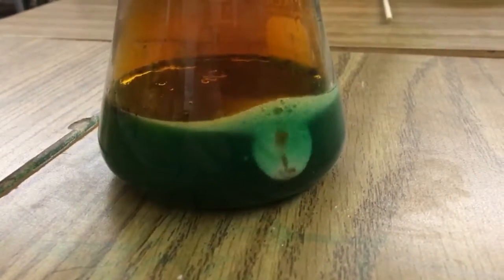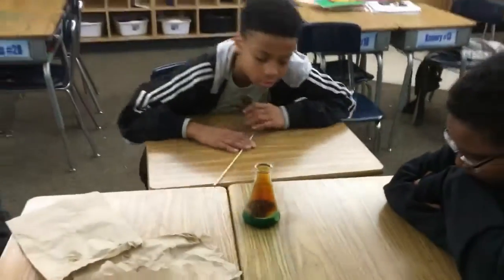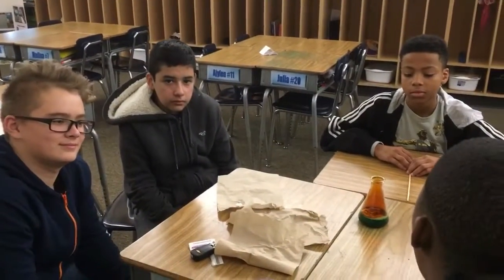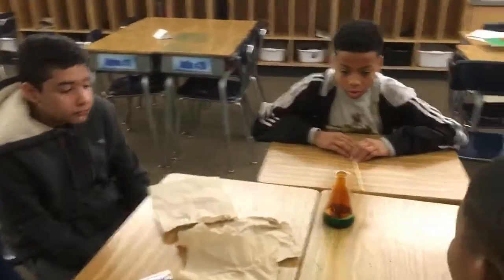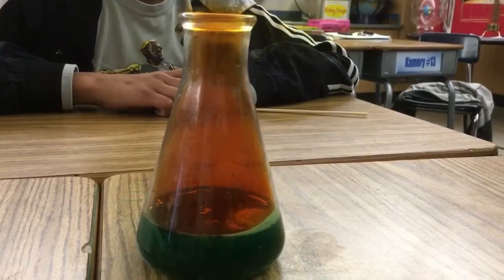gas. And you can see the penny over here on the side. There's the penny, and you can see that it's starting to float now. That doesn't look right. Pennies aren't supposed to float. Why is the gas brown? Why do you guys think that the gas is that brownish color? That's the color of the penny. It's the color of the penny, yeah. And it's got kind of a stale smell to it. If you look at the top, you can actually see the penny is decomposing so much that it's floating. You see the penny floating there?